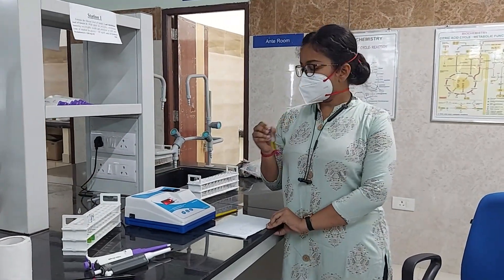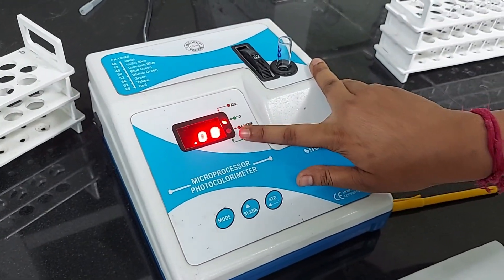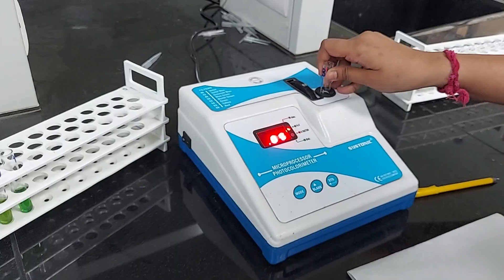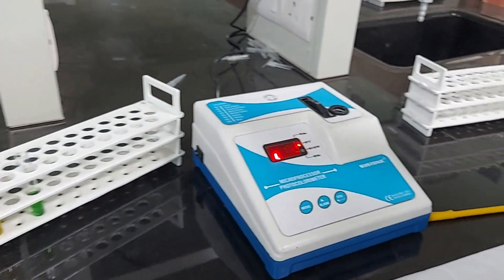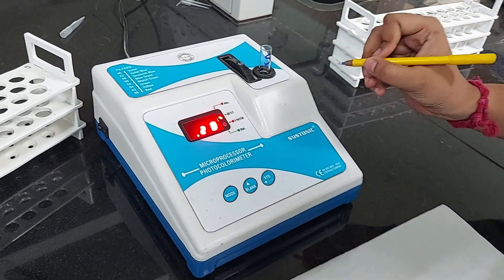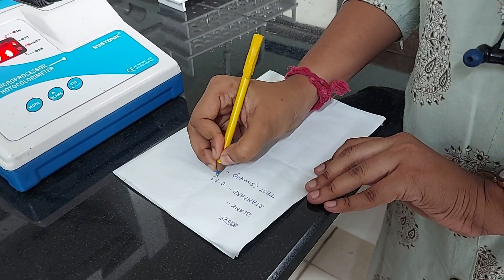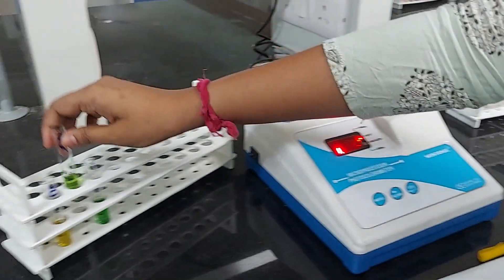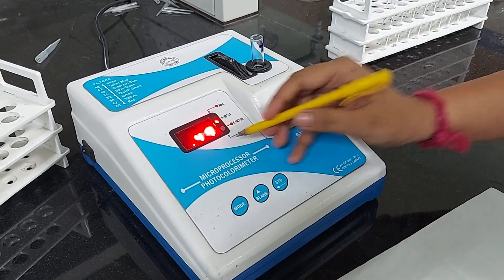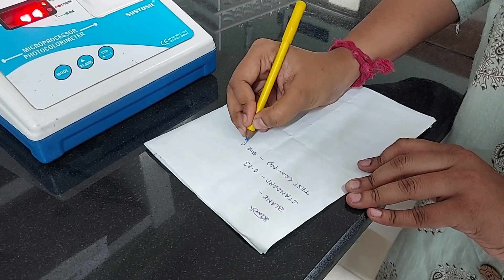Now we are placing the blank test tube in the cuvette and it is showing 0.08 absorbance — we have to note it. We press the blank button and it resets to 0. Then I am taking the standard test tube, placing it into the cuvette, and the absorbance is 0.23 — we note it. After this, I am taking the test sample and placing it into the cuvette and the absorbance is 0.49 — this is also noted.